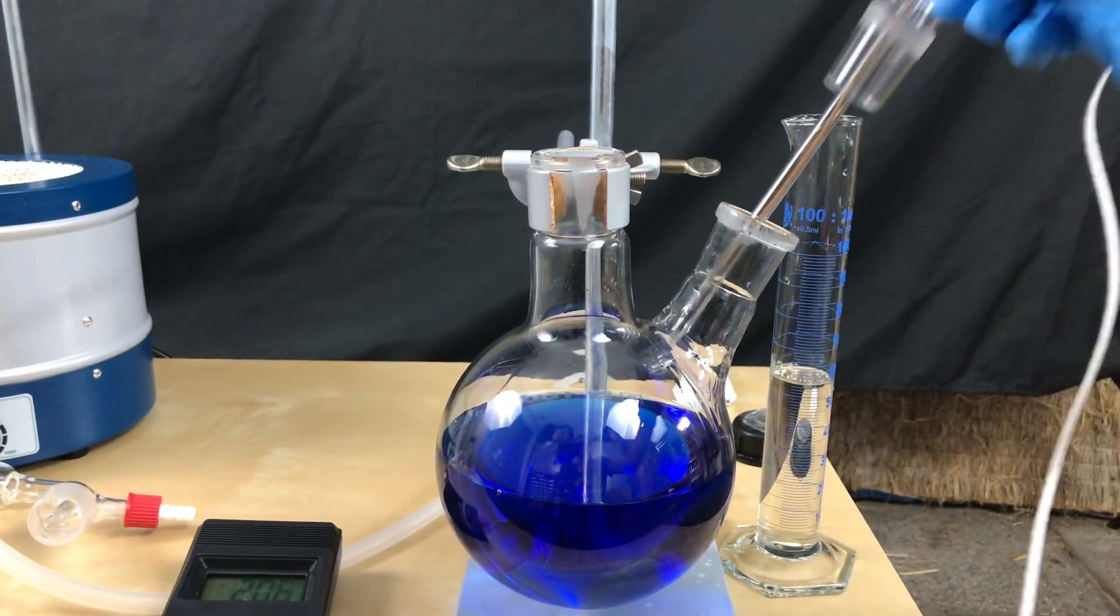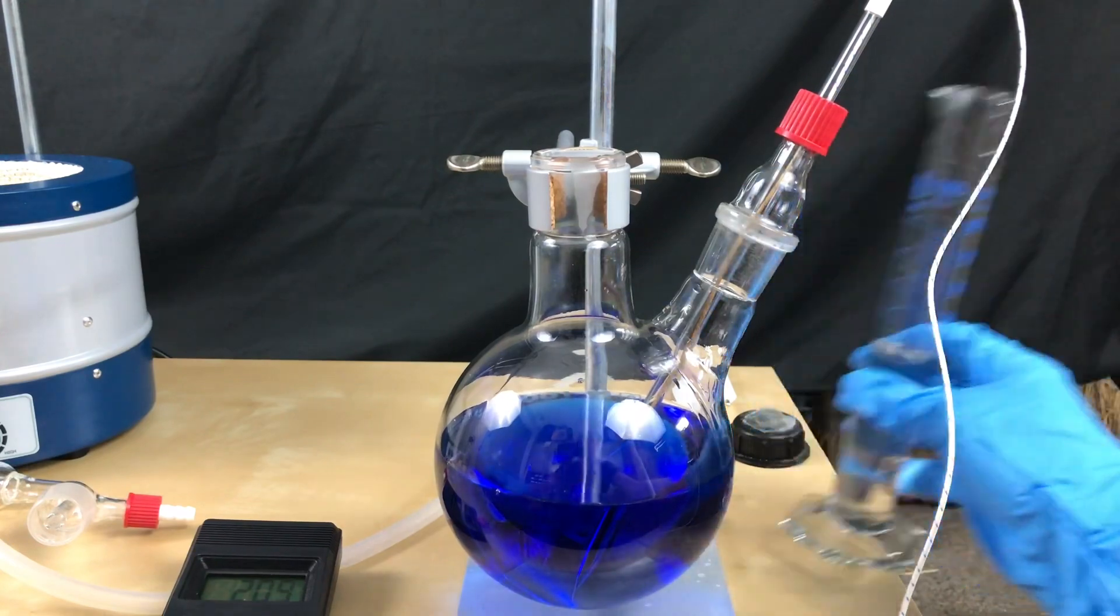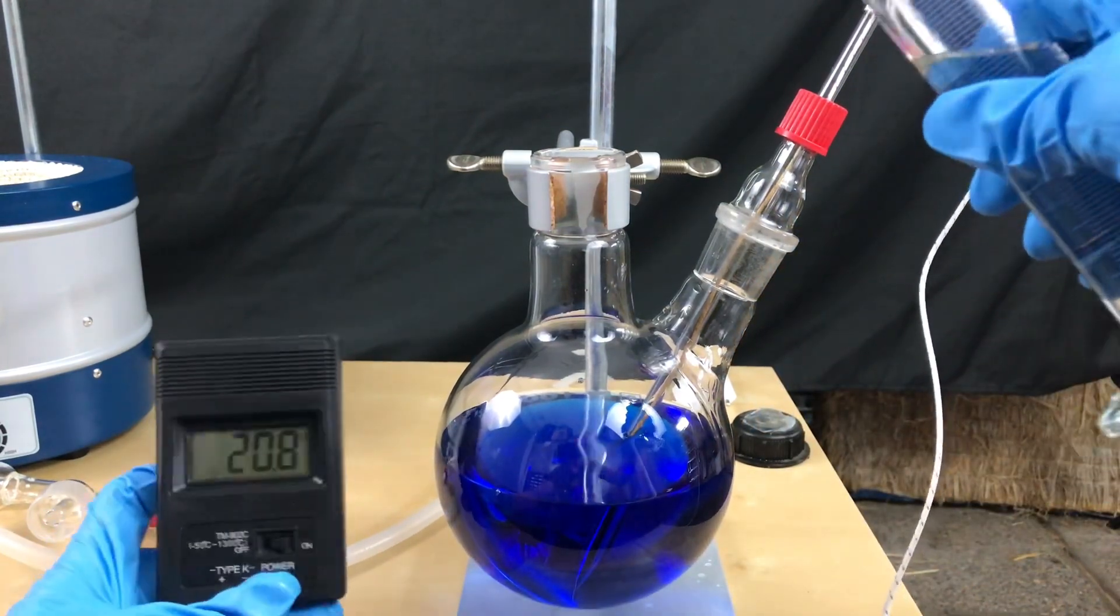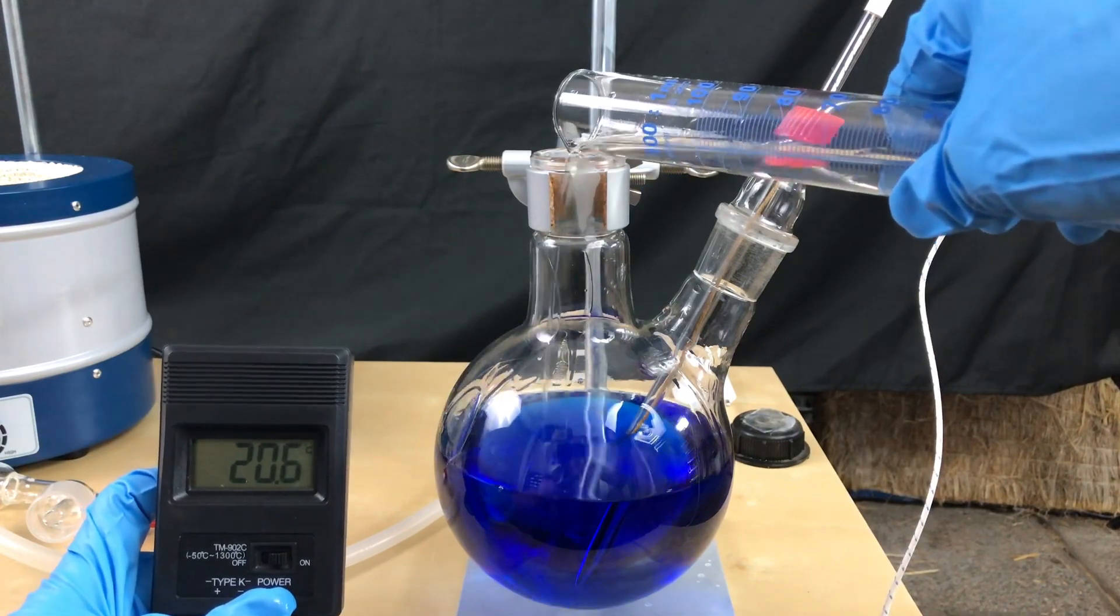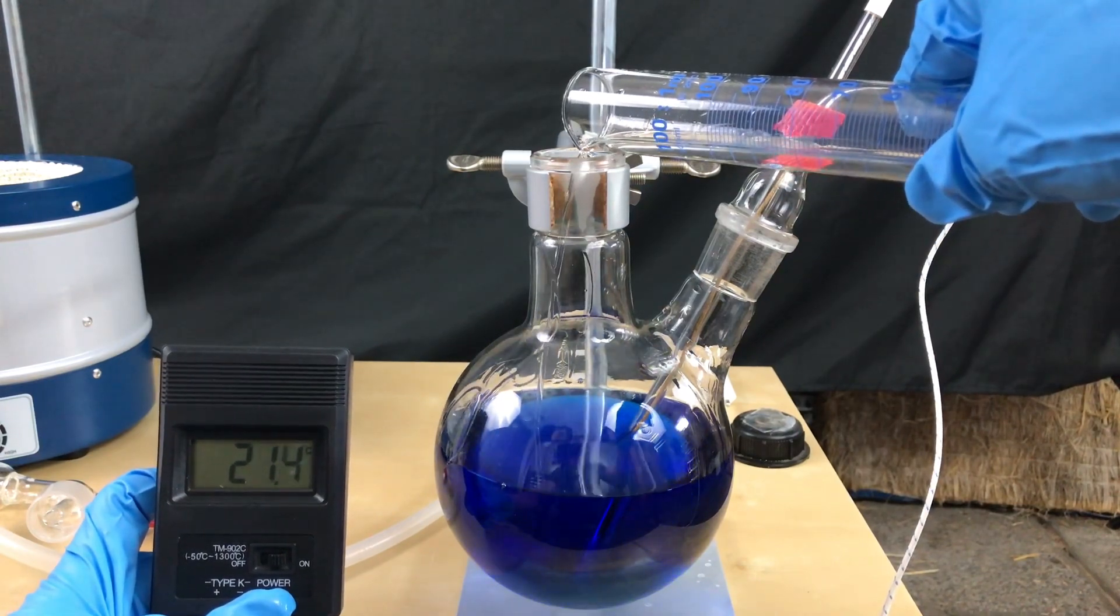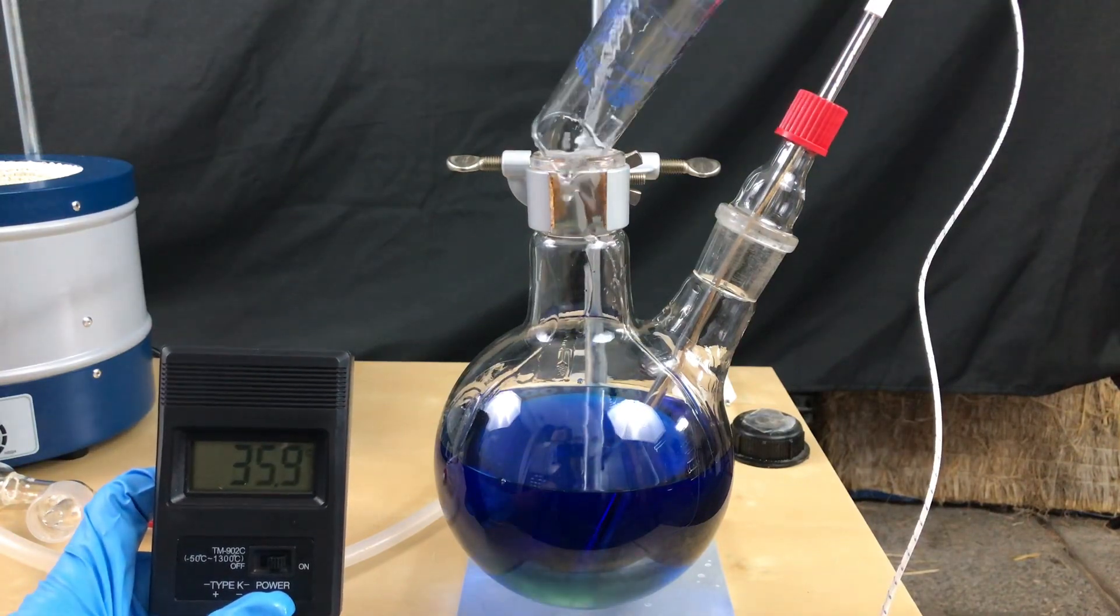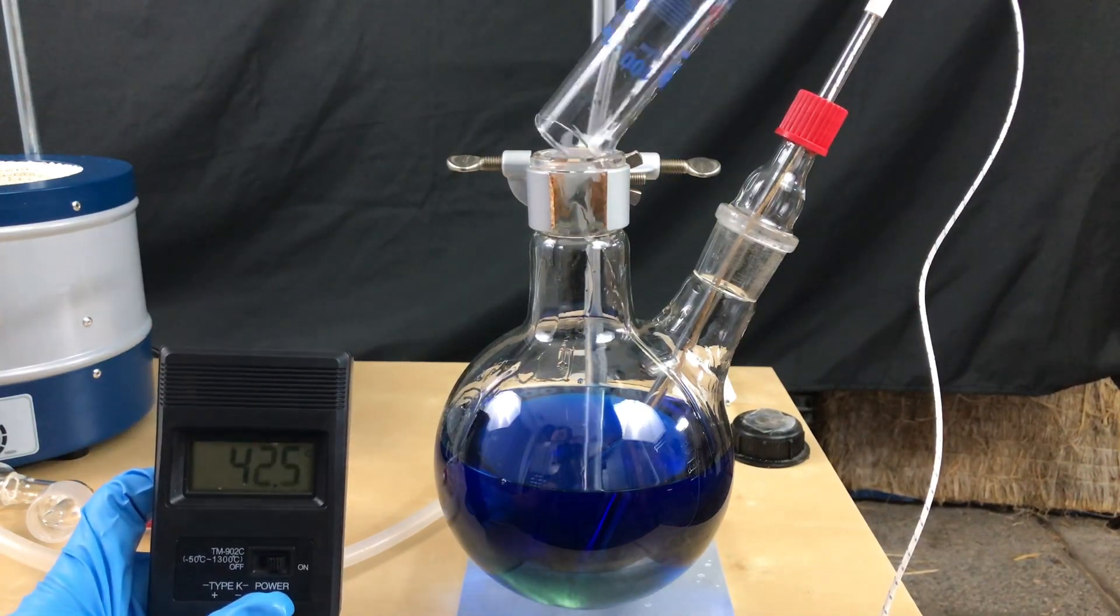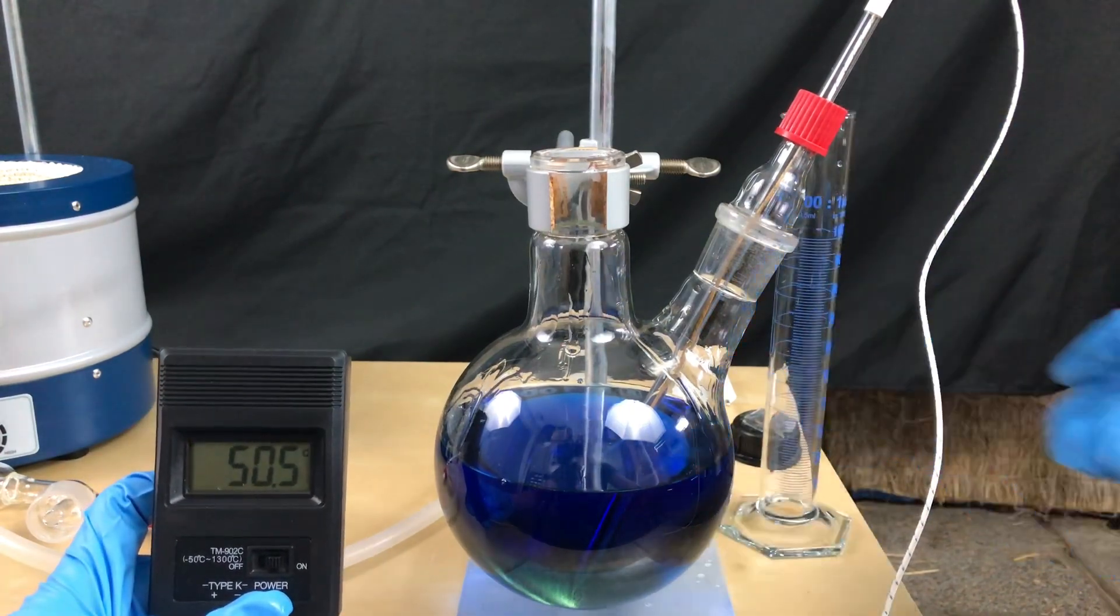I wanted to show how much our solution will heat up when we add sulfuric acid. So a thermocouple was added before I added the sulfuric acid. Then the sulfuric acid was just dumped in. We can observe an immediate raise in the temperature. This is also the reason that you add acid to water and not the other way around.